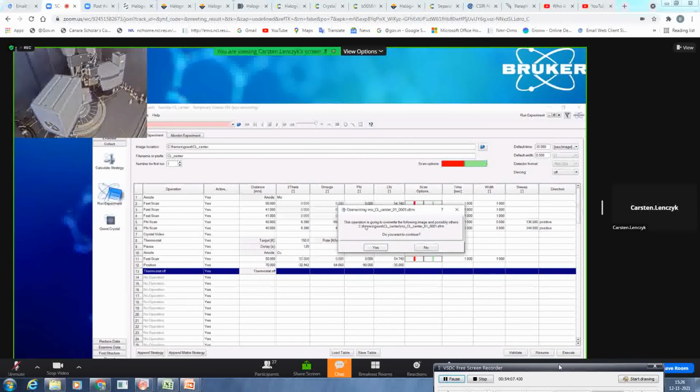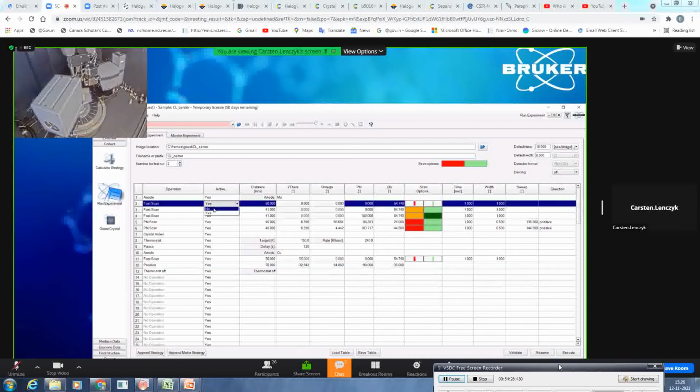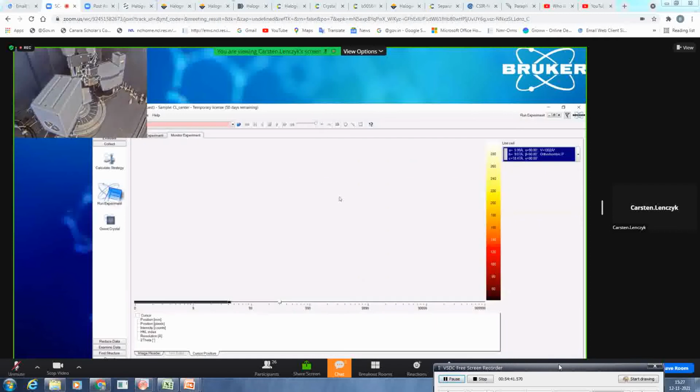It will now tell you, you already collected frames, and I found frames in your folder with run 1. So with your current setup, you would override what you already did. If you want to, just click yes. In that case, we don't want that. So we increase the number of the first run. And since we already collected it, we just deactivate it. So now we would execute. There's no error or message popping up. So it now will start your measurement.